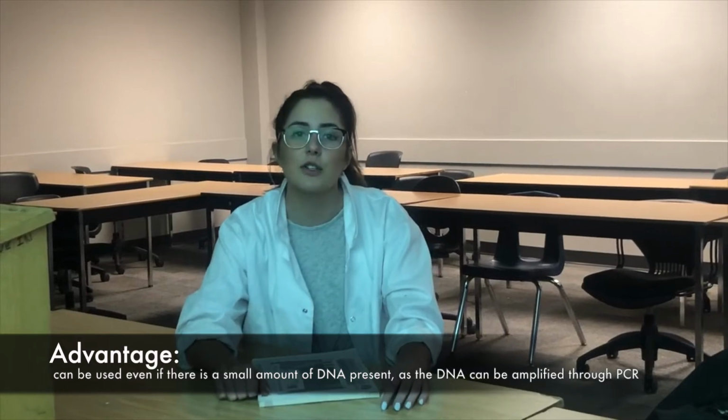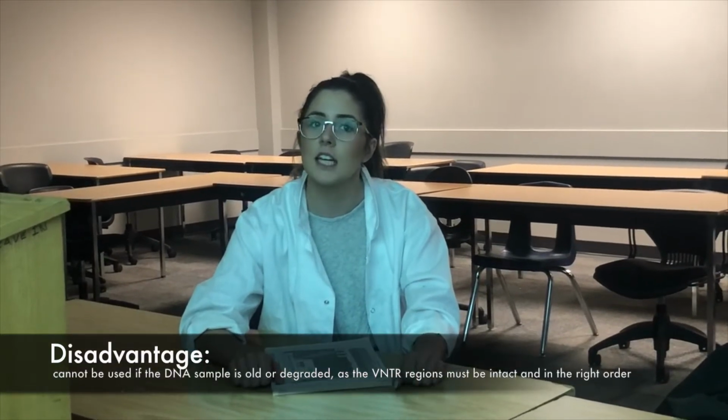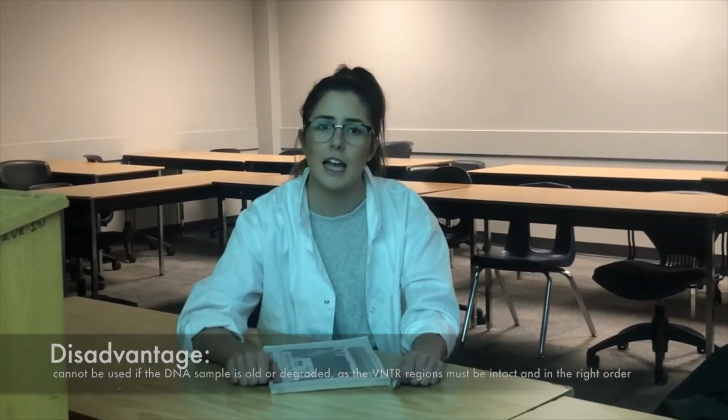VNTR analysis uses restriction endonuclease to cut the DNA in certain ways to allow the number of repeats in an individual's genome to be determined. If there is a small sample of DNA to analyze, PCR can be used to amplify this region. There are some pros and cons to all techniques, but for VNTR, an advantage is that even if you do have a small amount of DNA, you can amplify it through PCR. However, a limitation is that it cannot be used if the DNA is old or degraded, as the VNTR regions must be intact and in the right order. Whoa! So can you use the VNTR analysis to find the murderer?